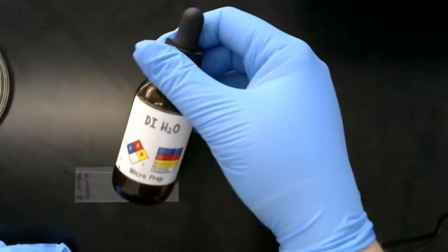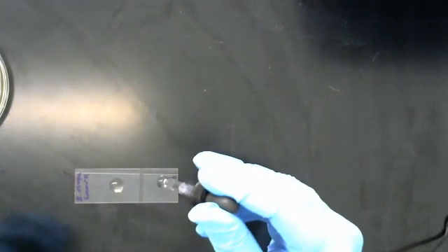For this, we're going to need deionized water, and we're going to start by having a single drop of deionized water on the slide, right like that. And you can do multiple Smear Preps on one slide, which is what we're going to do here.